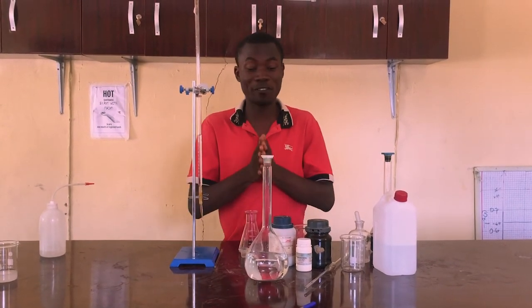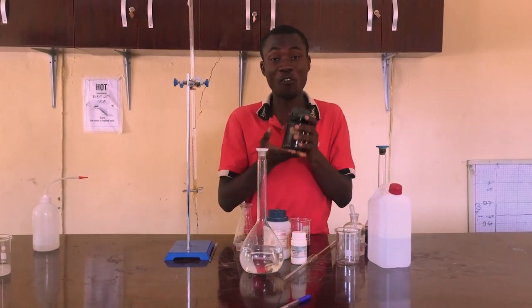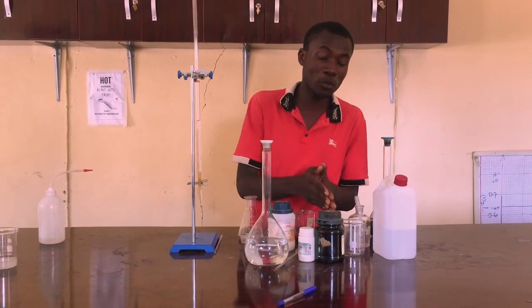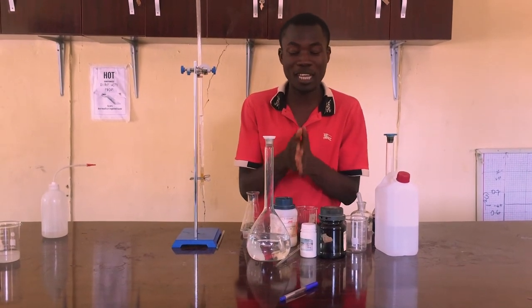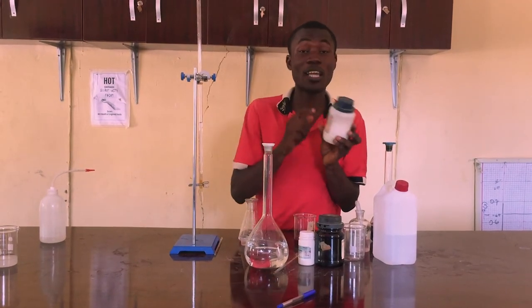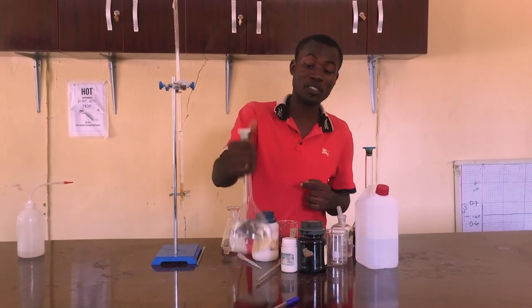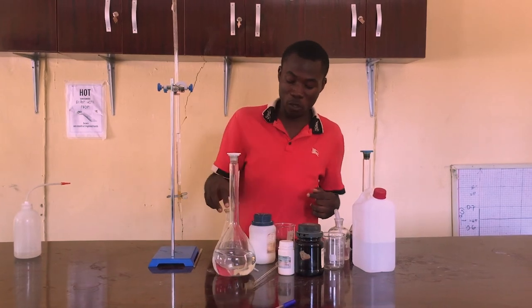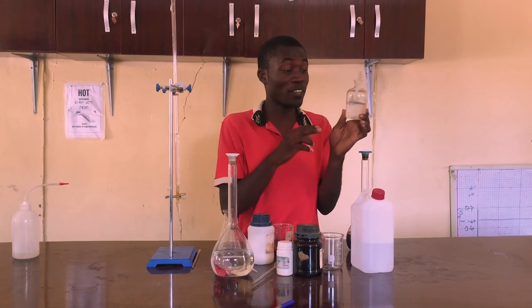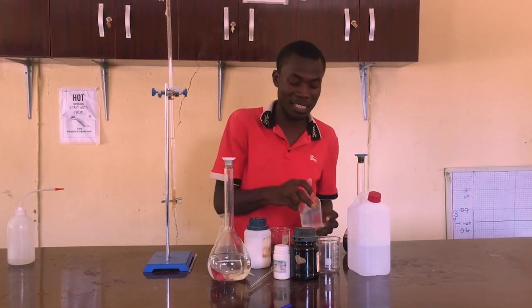This is just the summary of the titration processes. Major emphasis: please know the amount of iodine you are putting in, and have the potassium iodide well prepared. It is advisable to find a suitable form of iodine that can dissolve in potassium iodide — generally iodine dissolves in potassium iodide. Also, know that the sodium thiosulfate you are using is of analytical grade and is dissolved properly following the normal guidelines. Also, know that your starch should be prepared in a way that it is very soluble — as you can see, my starch is very soluble and just viscous. And that is how we prepare it.